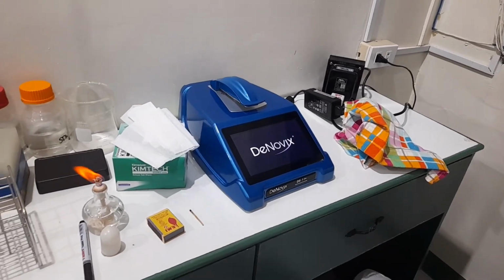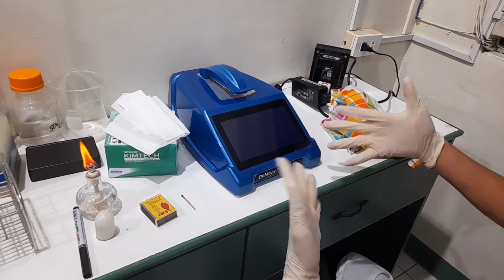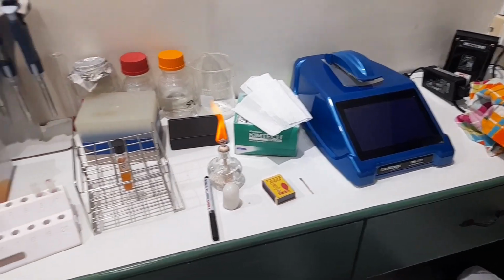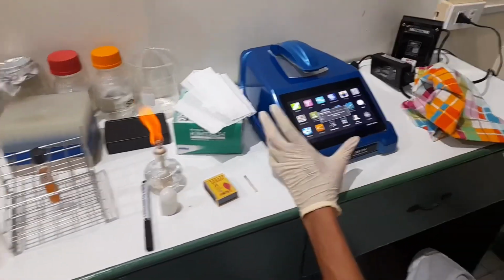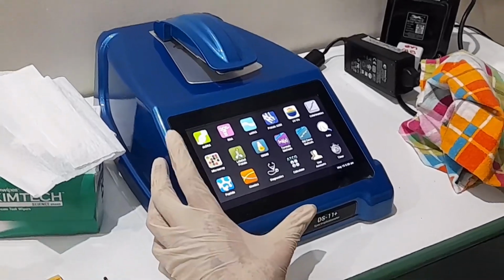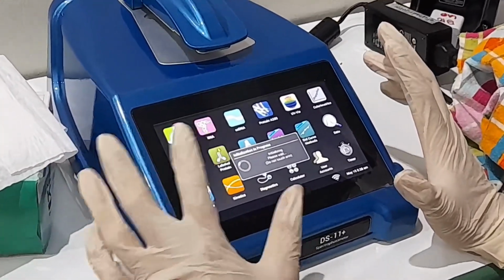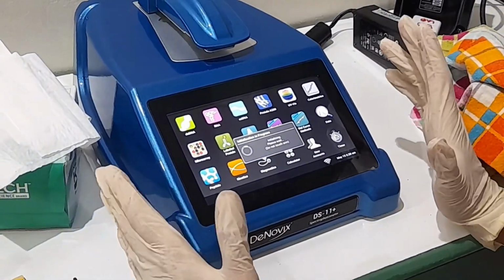So the nanospec could also be used in different ways. It has different apps, different UV lights that are absorbed. And here, we can also see, for example, in our extracted DNA, we can check, or our extracted RNA, we can check if our RNA is there.